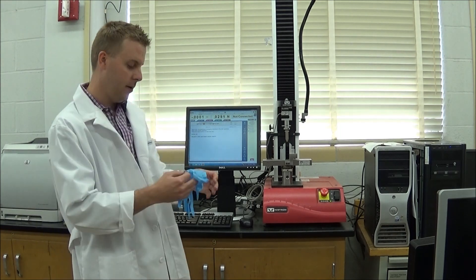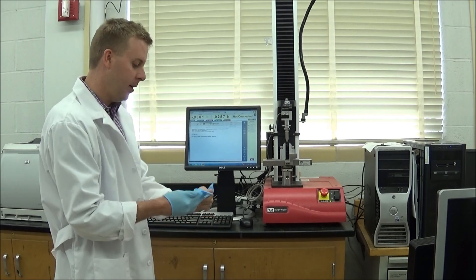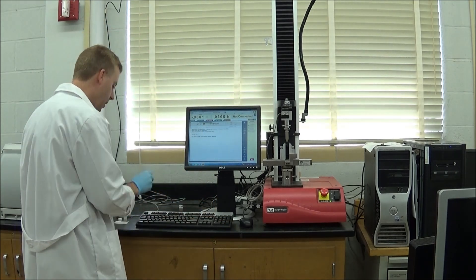To give you a little bit of information about this femur, we're going to use our gloves here just to be safe. This femur was actually given a bone loss drug treatment. If you remember the Sally Field commercials from a long time ago, she used to advertise this drug called Boniva. Boniva is a bisphosphonate and what that does is it slows down the amount of bone loss. The drug that this bone was treated with is a new drug called zoledronic acid and is supposedly much more potent than Boniva.